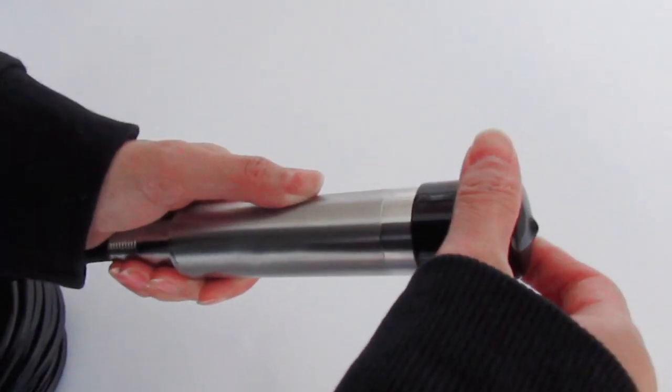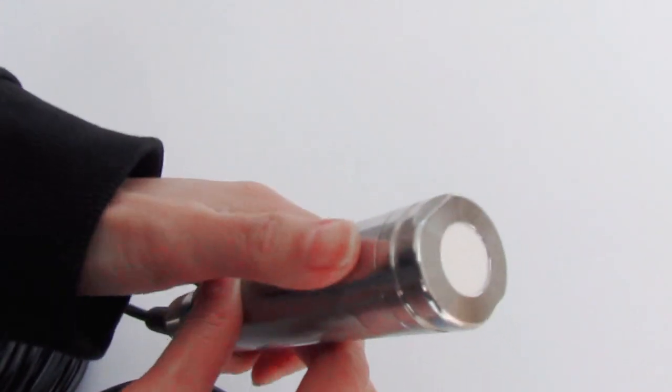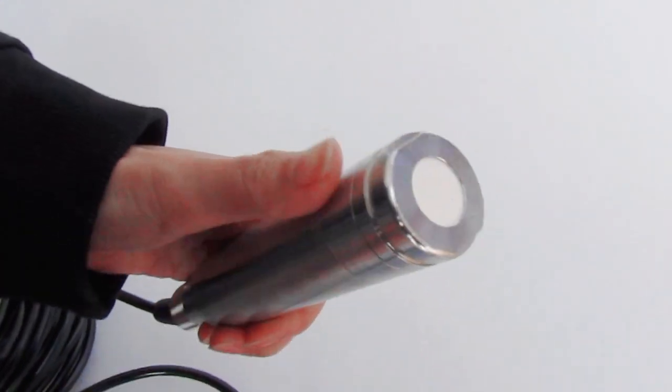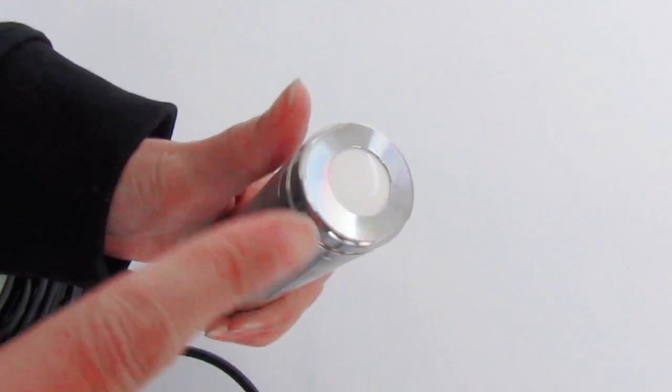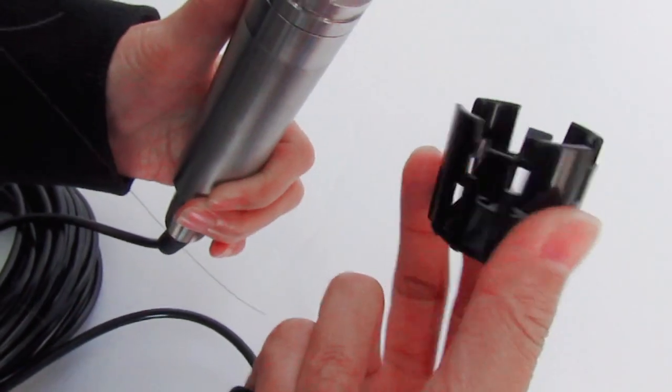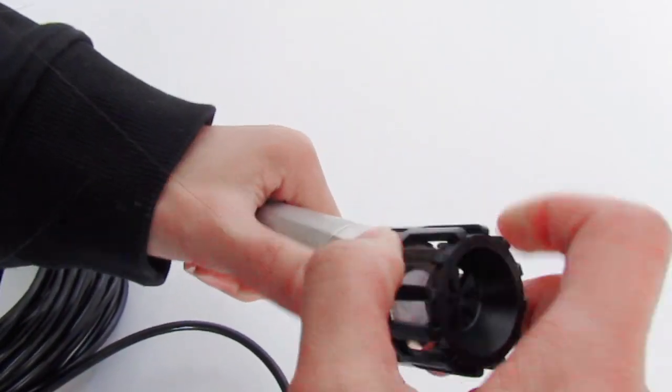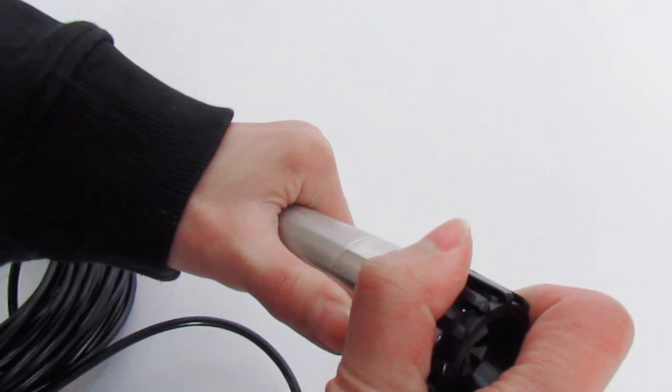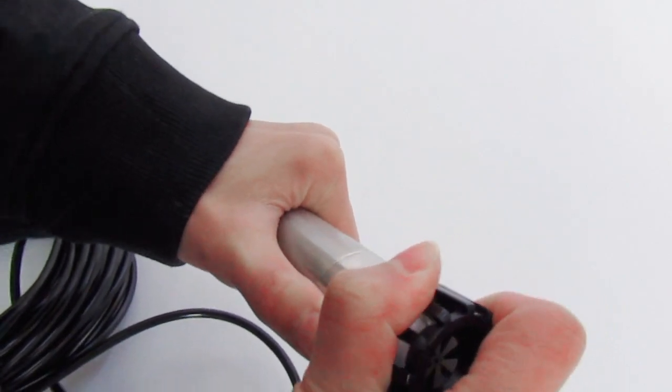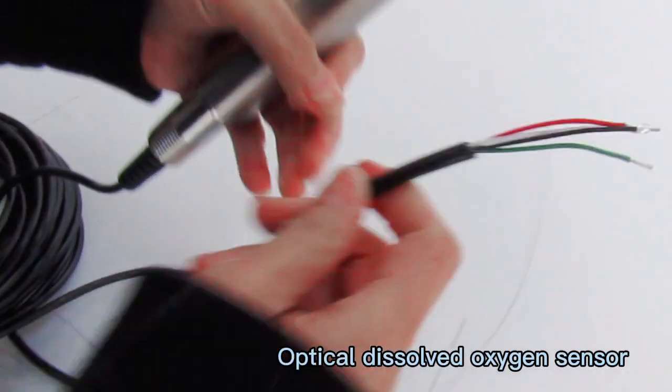When you receive this sensor, you need to take this cover out. It uses optical principle and is maintenance-free. We provide this cover to protect the sensor head and prevent fish from biting it.